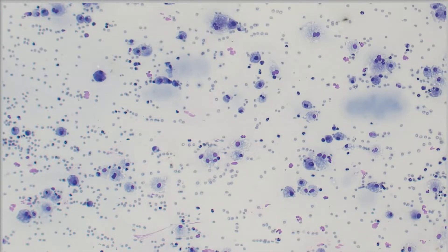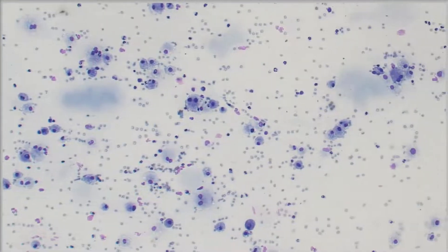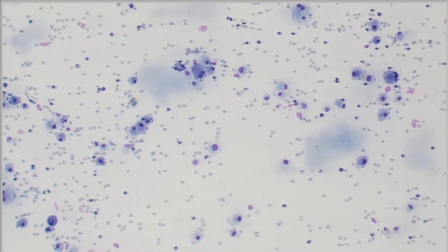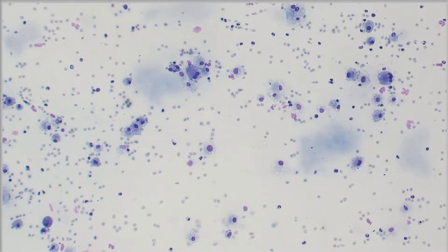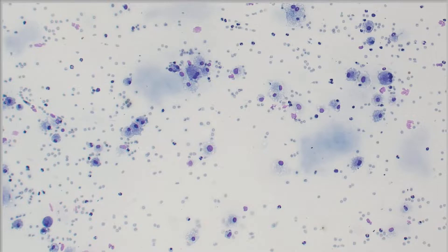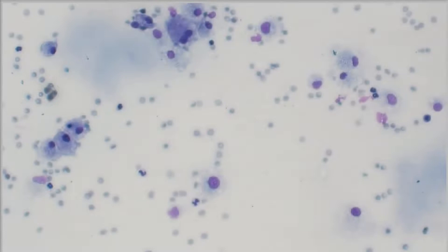So it's a very nice cellular sample and I'm just going to scroll around a little bit so you can get a good feel for what we're looking at here. When we pop in, I'm actually going to go back to 10x in just a second, but I want you to see what these nucleated cells are. We can start to see what they are from this objective, but let's get a little bit closer so you can see better.